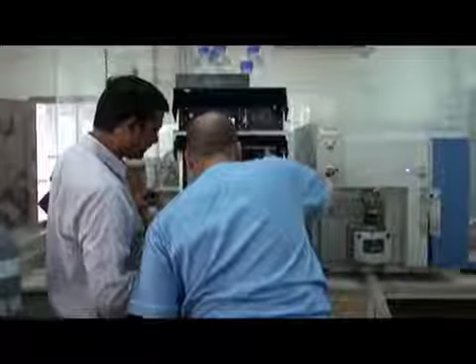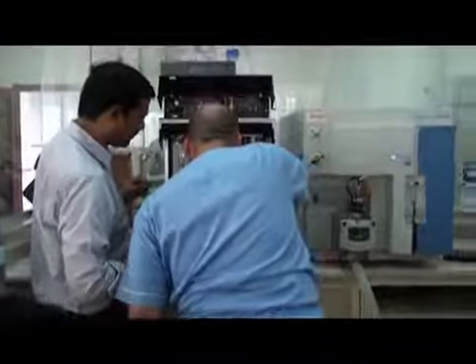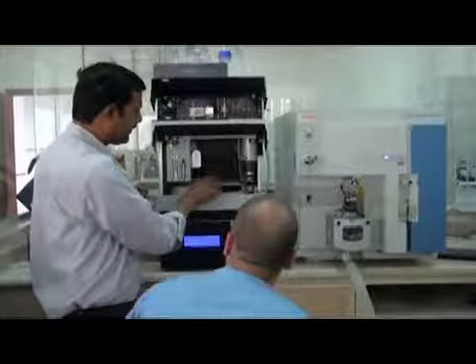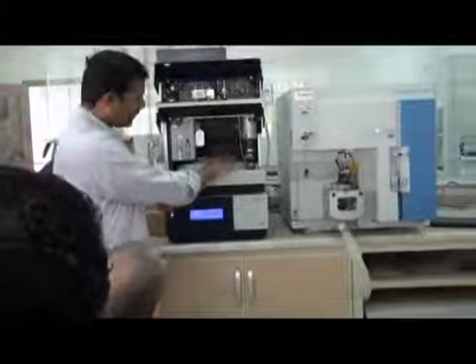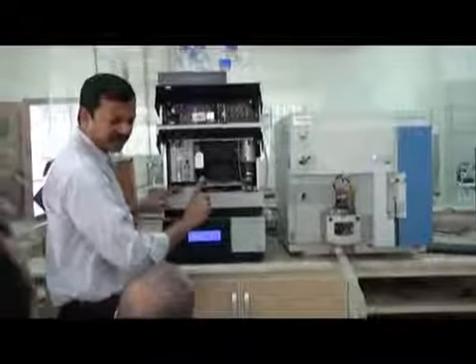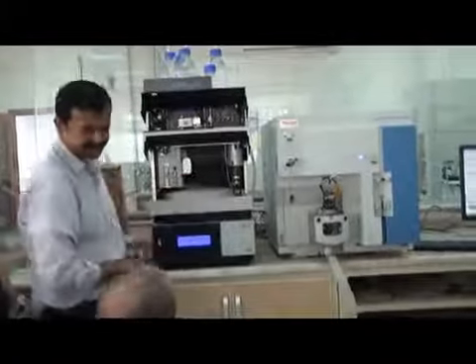Yes, this is R. Now move it, it will not move. This is in the correct place. This is the cover. Just put back the cover. When it injects, it will open the cover, inject, and close the cover automatically. If you leave it open, it will not close automatically. So always leave the cover closed.